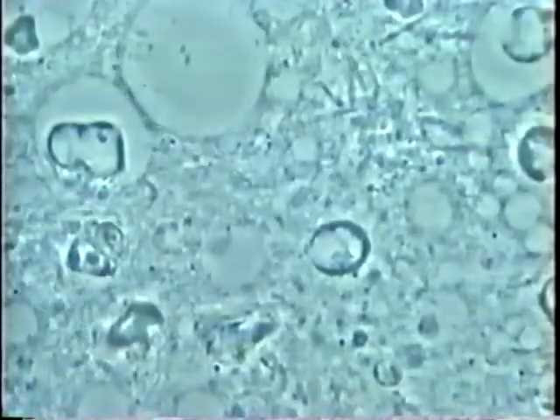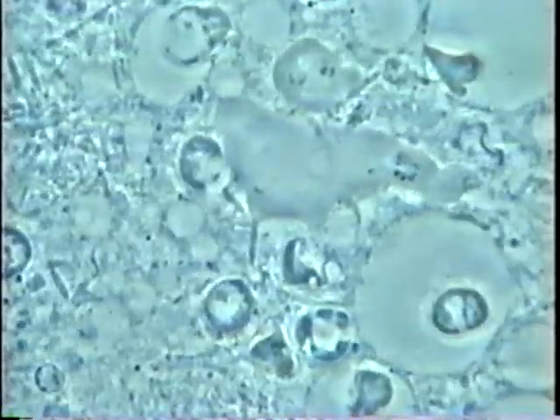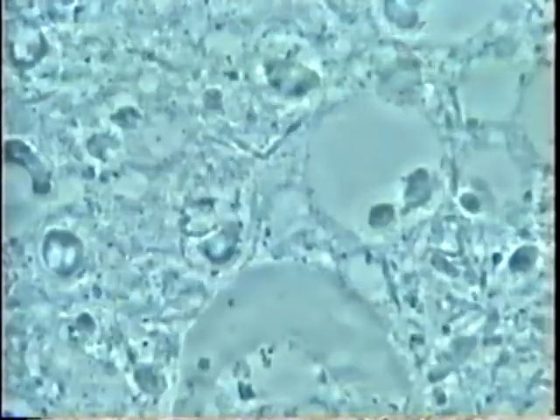A lot of activity, a lot of bacteria, a lot of white cells, a lot of little amoeba — one or two or three on the field. So this is very active periodontal disease.